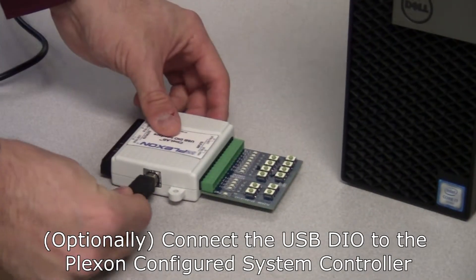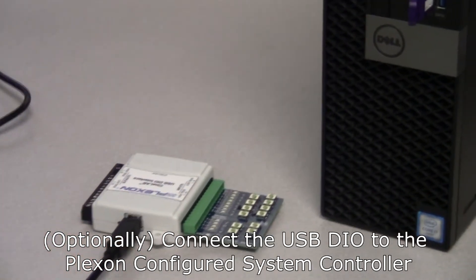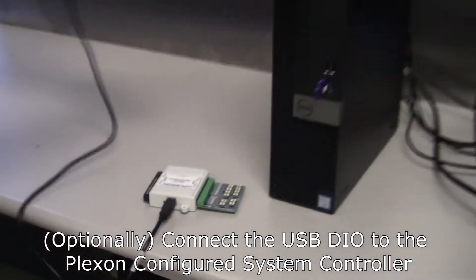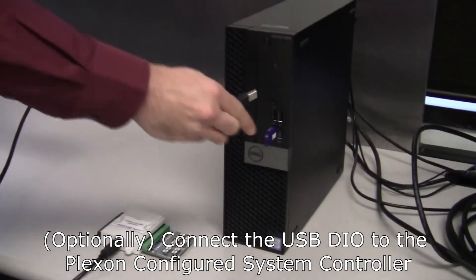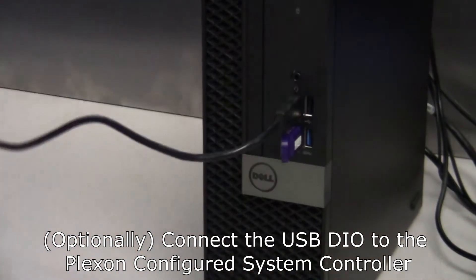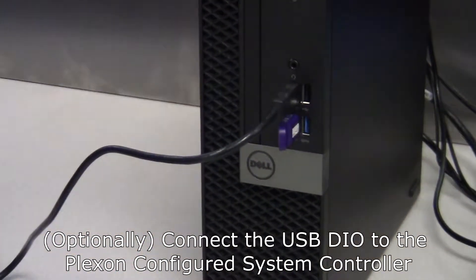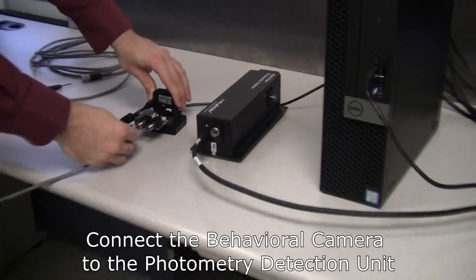Optionally, if you are using input or output lines on the USB DIO interface, connect the interface to any available USB port on the Plexon configured system controller now.